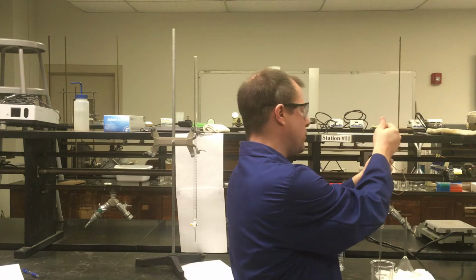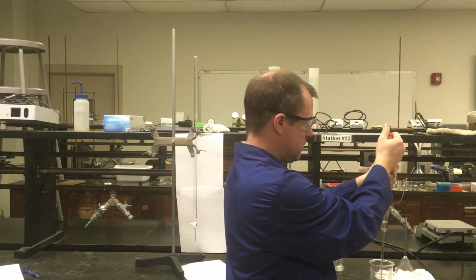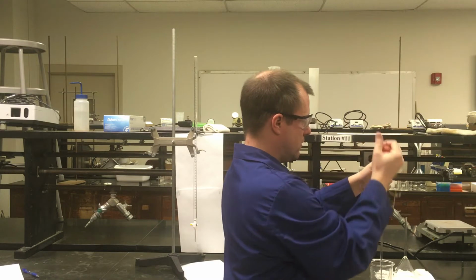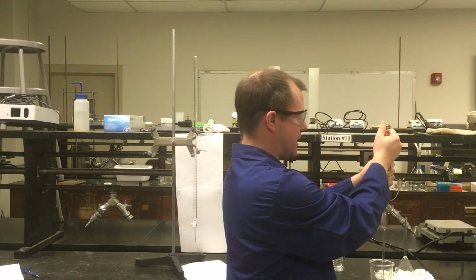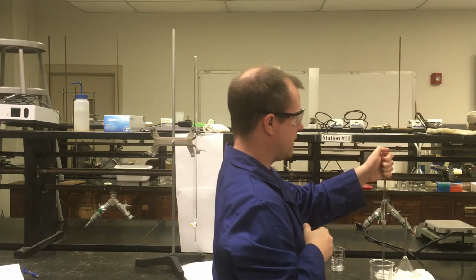So I'm going to pull out more and try and fill my pipette here. That wasn't a very good seal when I first put it on here, so I'm going to take probably one more squeeze. Right, and the goal is I want to pull the liquid level slightly higher than the line I'm trying to aim for, because as soon as I pull the bulb off, that liquid level is going to start dropping. And so I'm going to pull the liquid level a good bit above the line, but not up into the bulb itself, and then immediately cap it with my thumb.